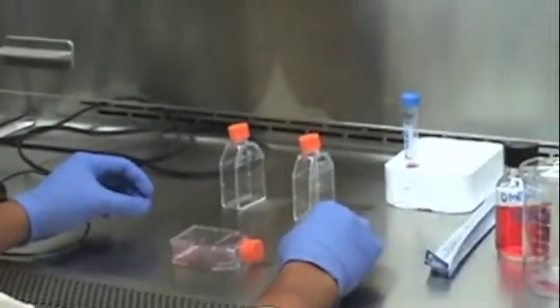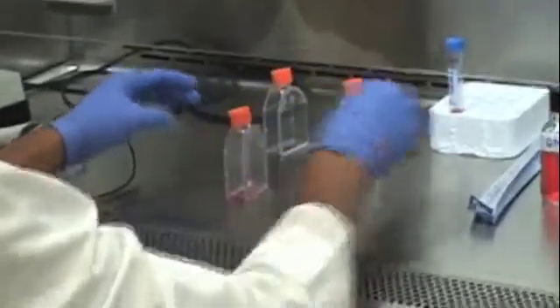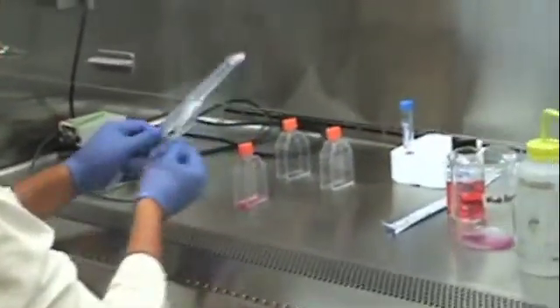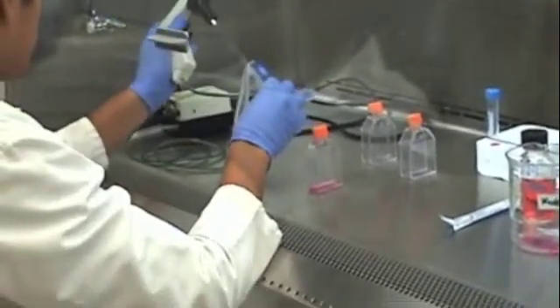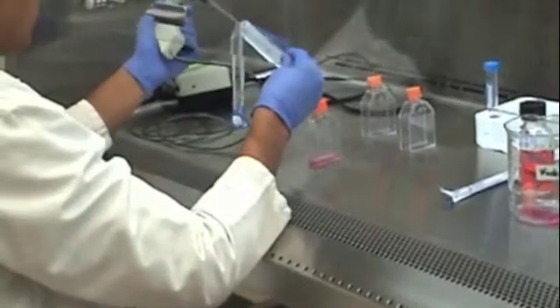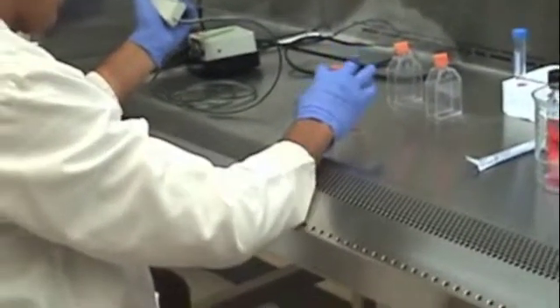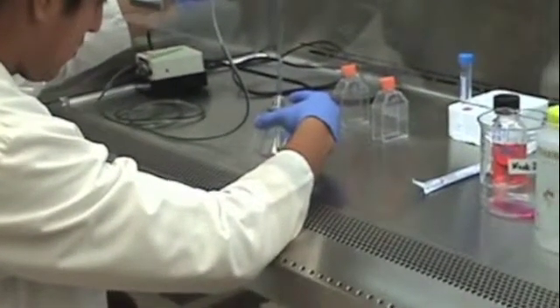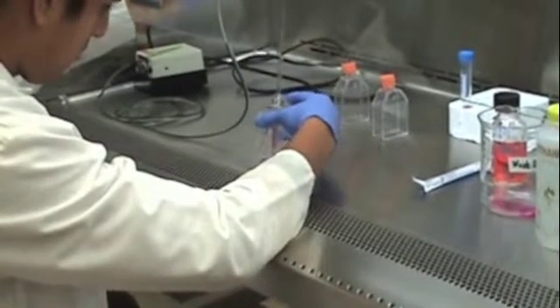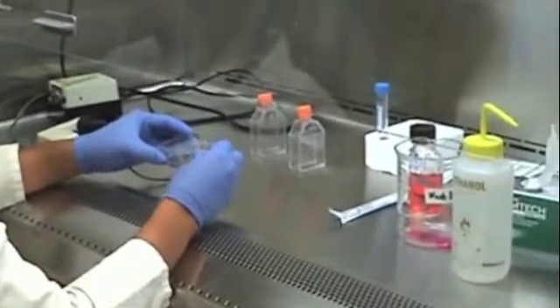After leaving the trypsin for 20 seconds, you want to remove the trypsin. Now we want to proceed to the microscope and check that the cells are actually suspended.